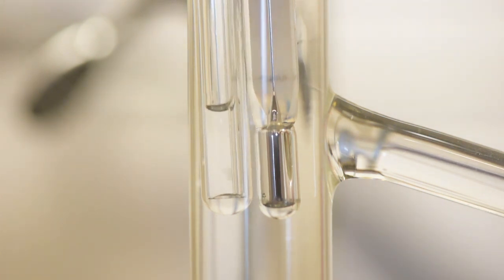You will likely notice some bubbles evolving from the tube well before the boiling point of the sample. This is because as the temperature increases, the volume of the gas within the bell tube will expand and some will escape. Do not write this temperature down. Wait until there is a fast, steady stream of bubbles.